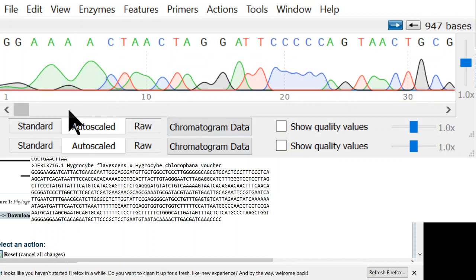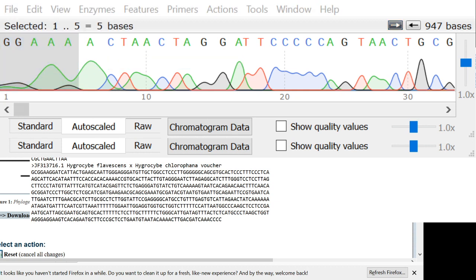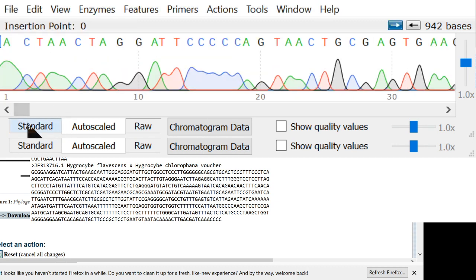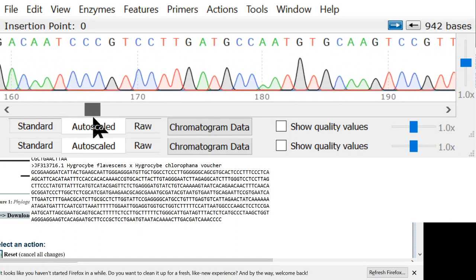Looking at this LSU trace, you can see it's kind of weird here. I don't really trust that this is correct. I think the first good peak that I see is the C, but the one before it was an A. So I think what I stopped trusting is maybe there's a G in here or something. So I stopped trusting it here. I'm going to chop off that end, and now we're going to scroll through the sequence and see how it is. And you see this data looks really good.